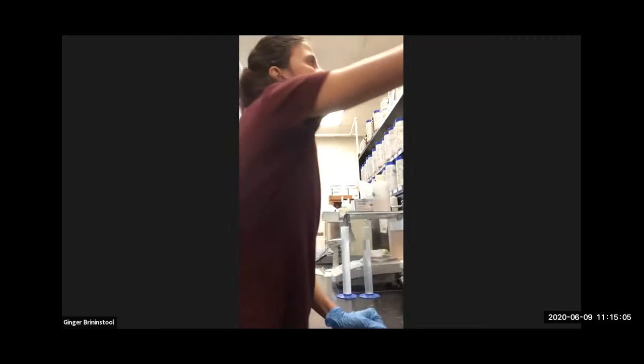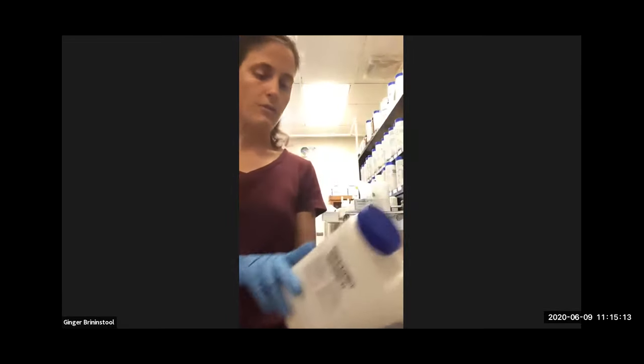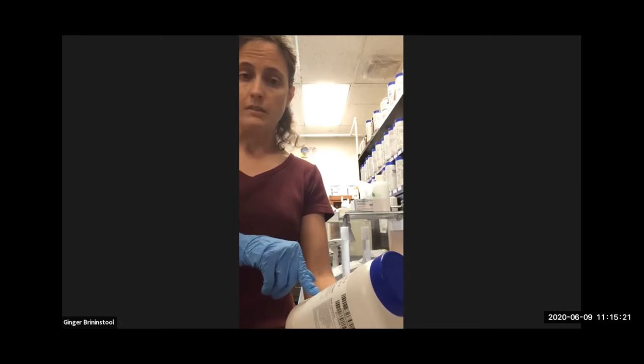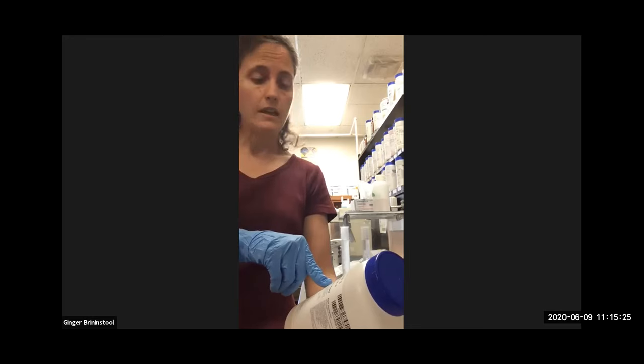All right, so before we start measuring out ingredients, I want to have a brief conversation. Let's do the agar first. Okay, so in addition to the ingredients that were listed here, I will put up the directions for you to read. I'm going to read it out loud to you because there's quite a bit here. But it's a recipe. It gives you the ingredients, but it also tells you how to make it.